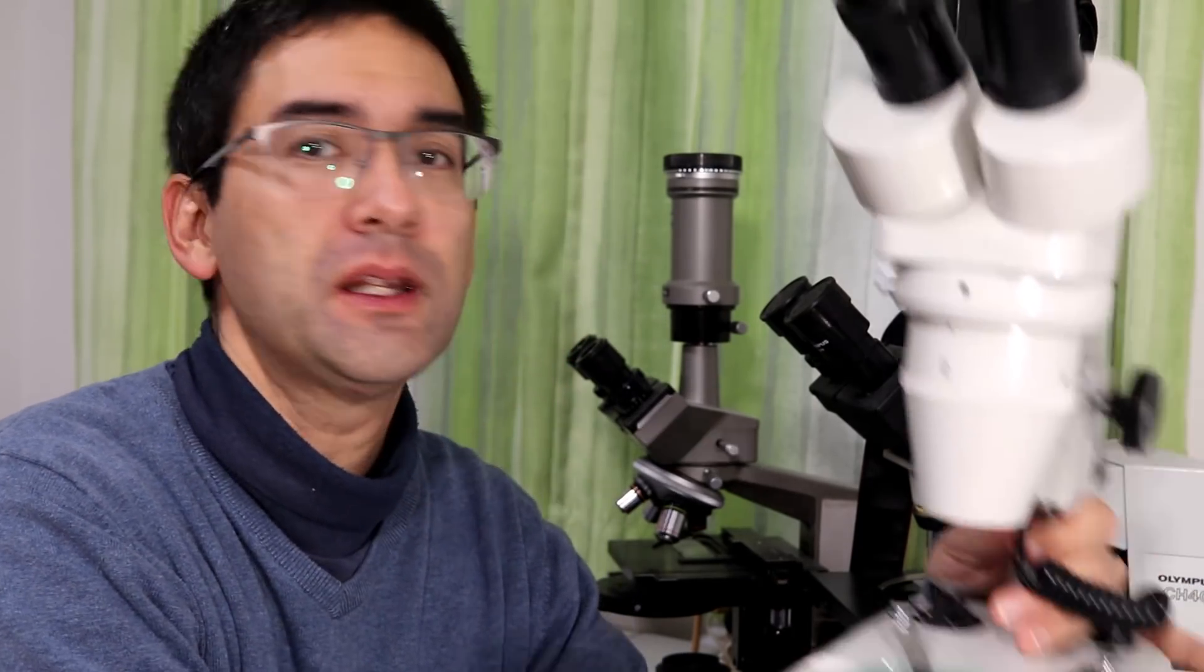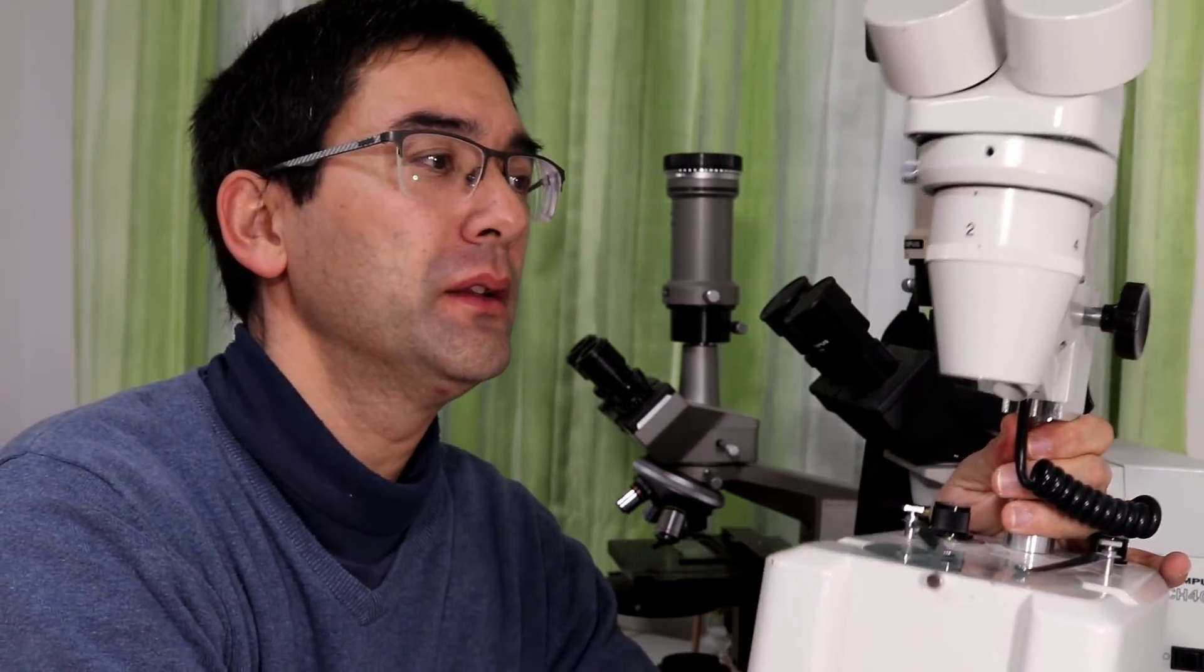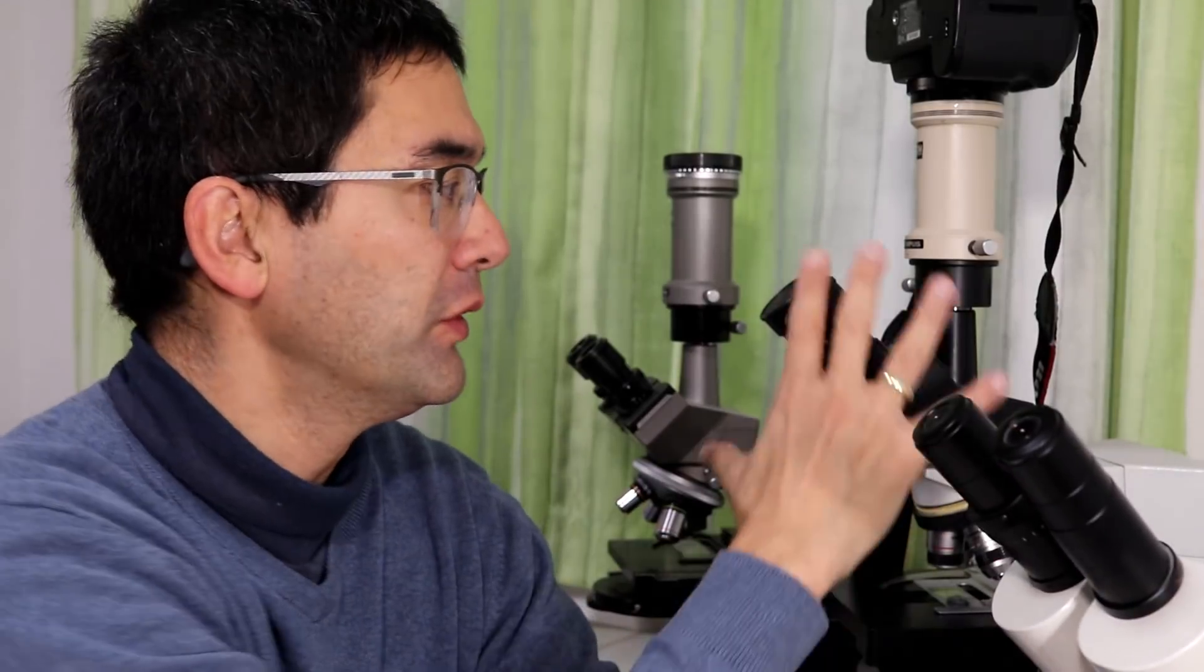I have one here. That's one of them and there is a fundamental difference between these stereo microscopes and the microscopes that I have standing over here on the side.